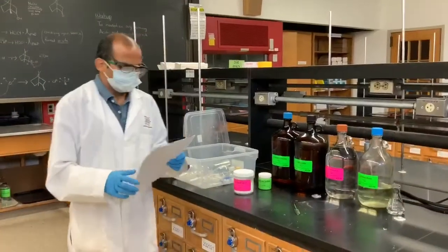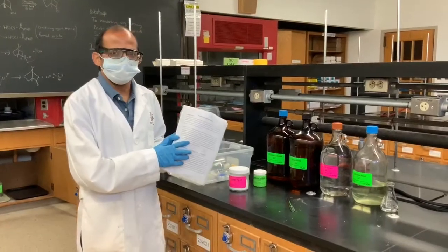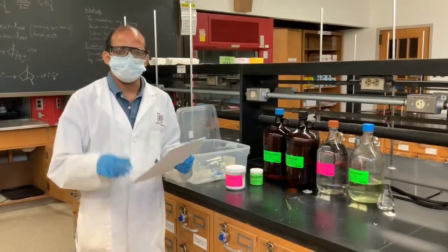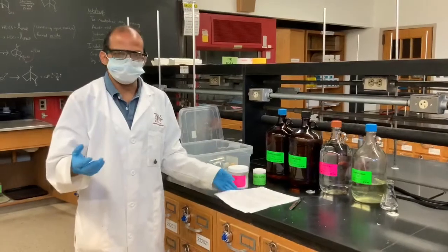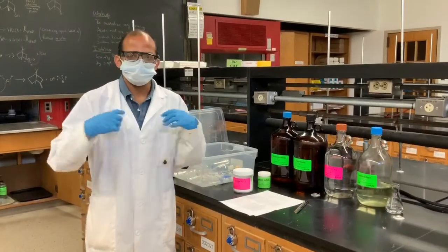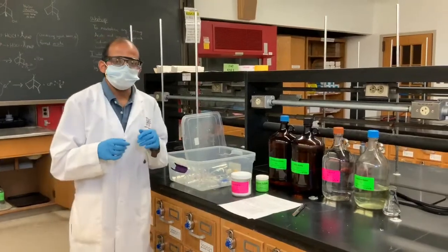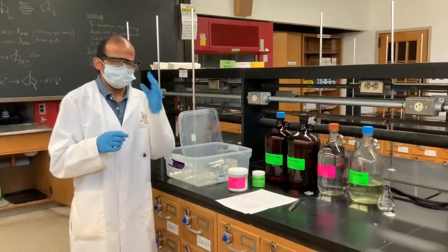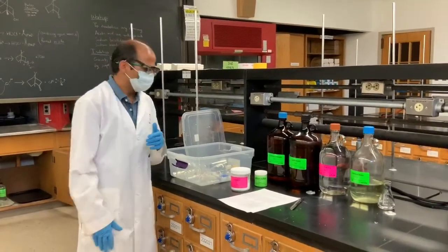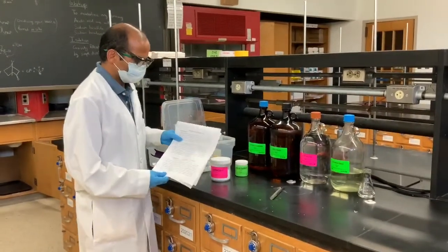Welcome to the oxidation of isoborneol lab. We are making this video keeping our protective equipment on: face mask, gloves, apron, and goggles. We are more than six feet away.